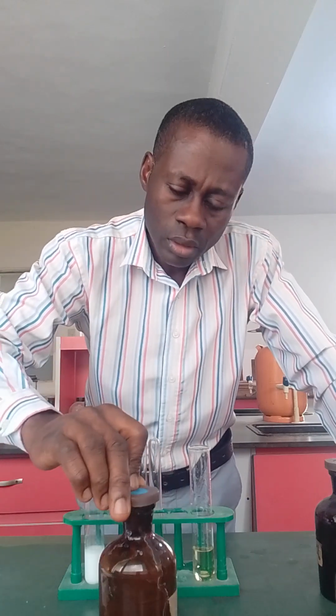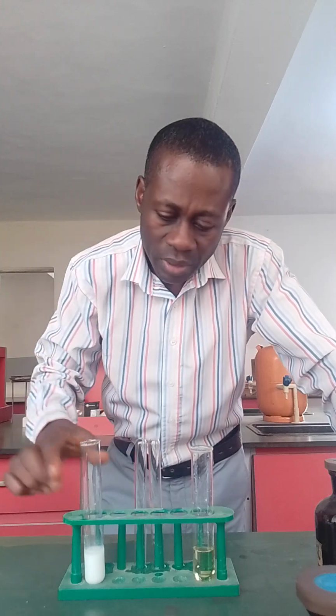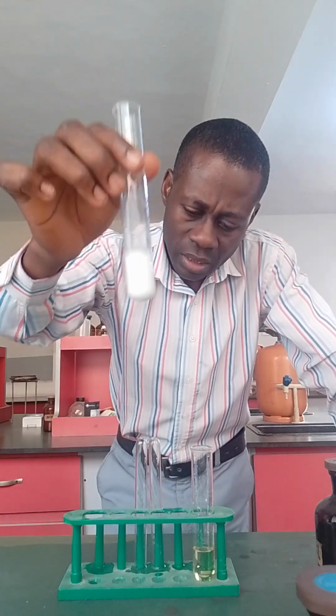All right, now mixing it in water and filtering, you put water plus solid. Under your observation, you give greenish blue residue and pale yellow filtrate, and under your inference, presence of copper and presence of sodium ion. Then if you test the filtrate with barium chloride and you obtain this white precipitate, that confirms the presence of SO4 2-.